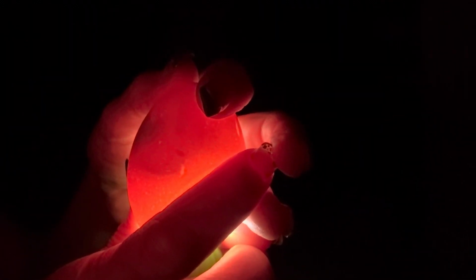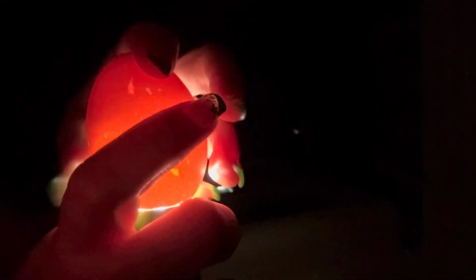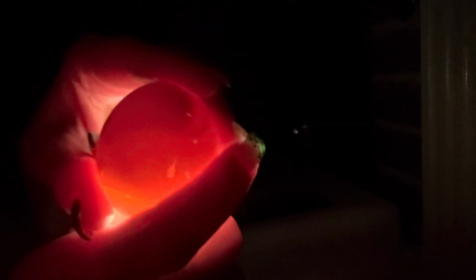This is one of our next eggs. This one I wanted to show you because it is pretty clear all the way around except for a black spot. That is more than likely not a viable egg. Pretty sure there are no veins, not seeing any kind of movement except a large black spot, which means this little embryo is not developed. So it will be one that we will get rid of in this process, but take a look at that. No movement and quite a bit of empty space inside of this egg.